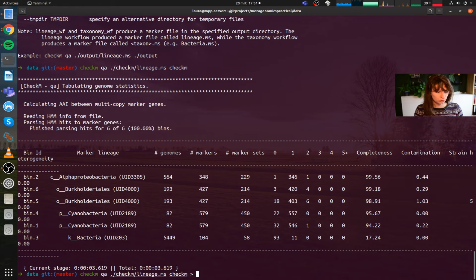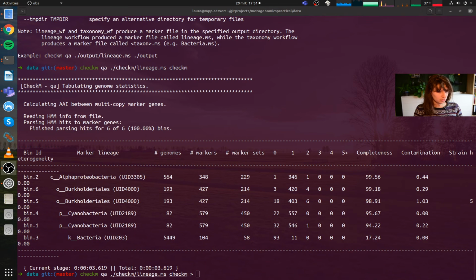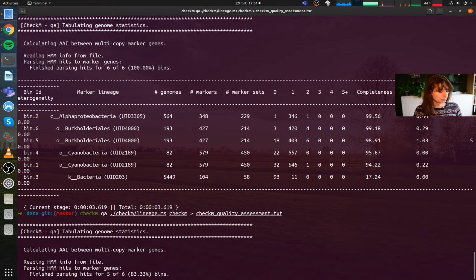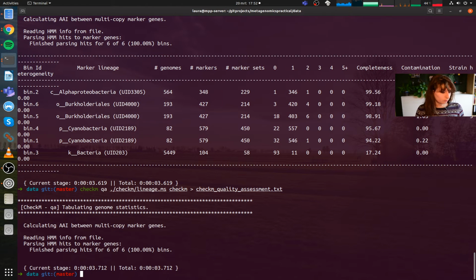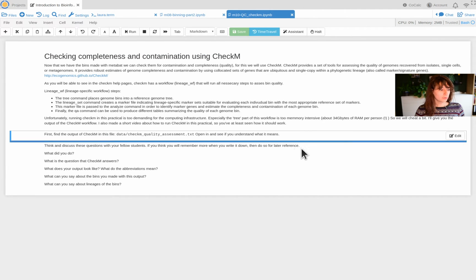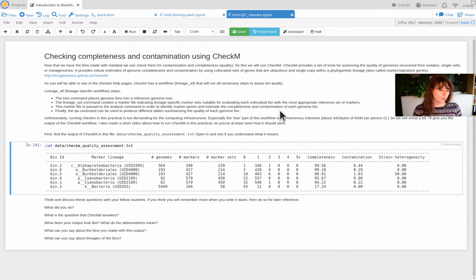And now I will write this to a file. Let me check how I named this file in the end. CheckM quality assessment.txt. Tick, tick, tick, and there you go. So this is the file you also have here, data, CheckM quality assessment. So now let's open this over here. Let's view this. Just do cat data checkm and cat. And there you go. You have this table.